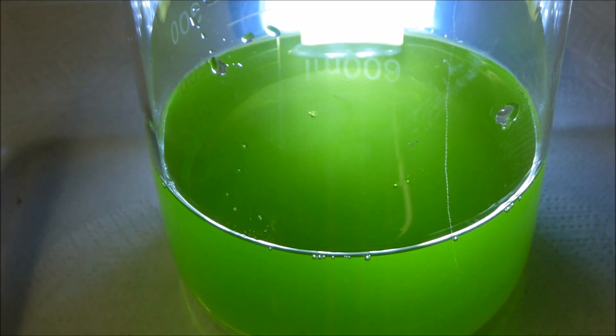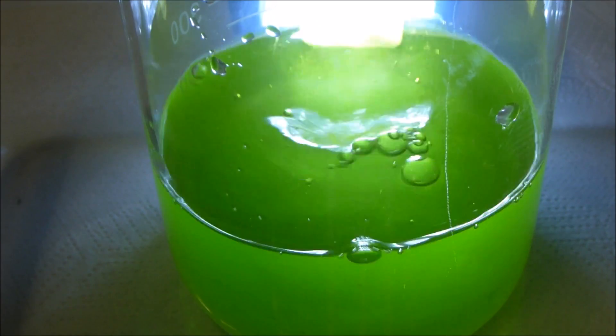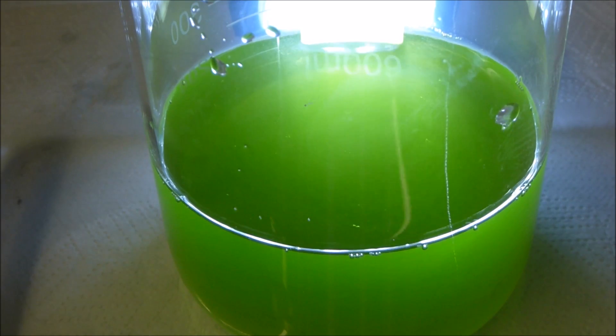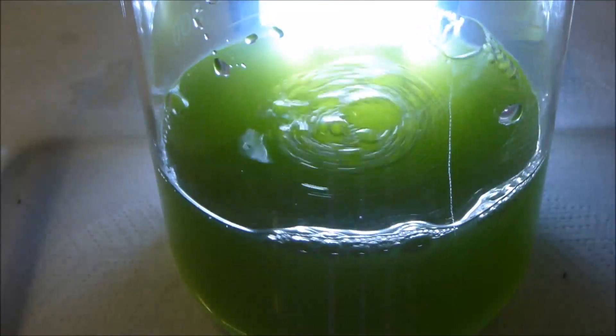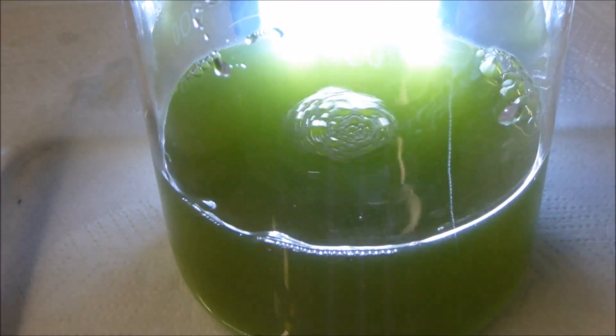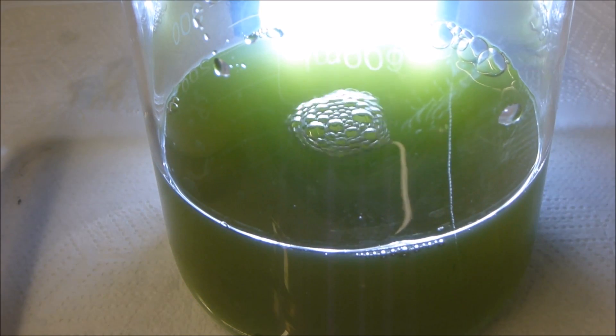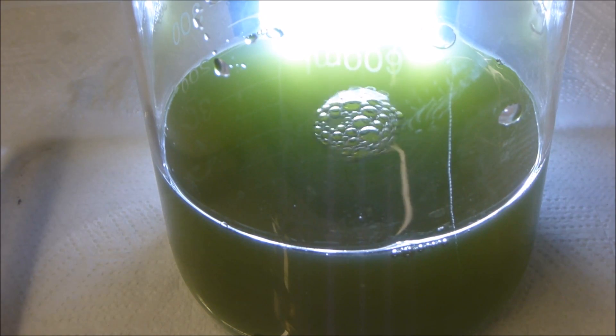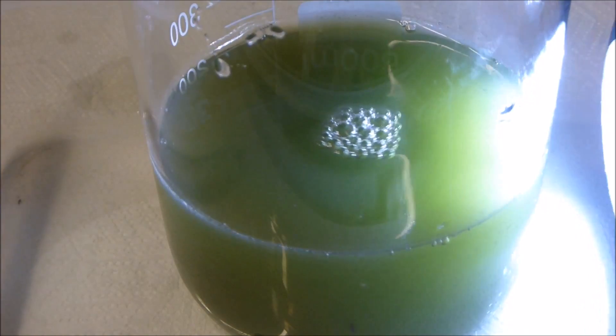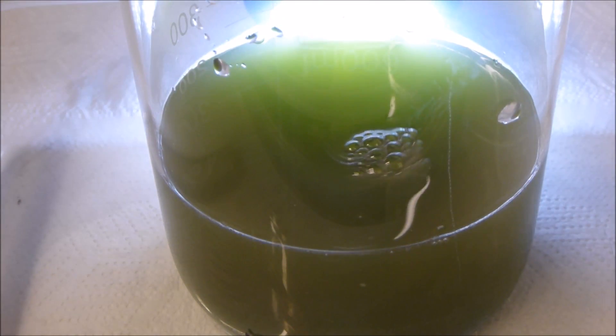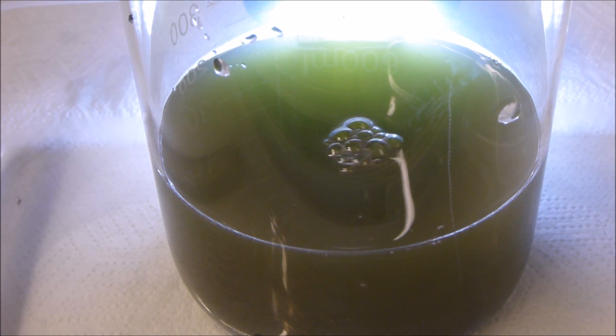We've got it in there. Give it a quick stir. Hopefully we should see a bit of the reaction happening there. Not super fast, but as you can see we are going quite brown there.